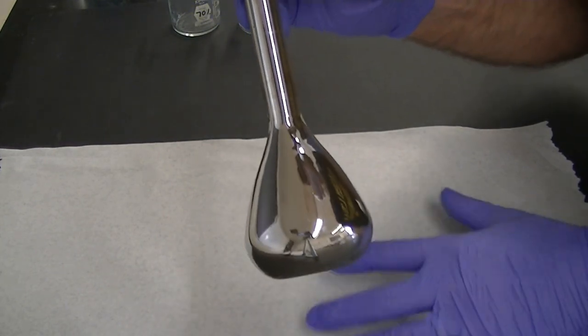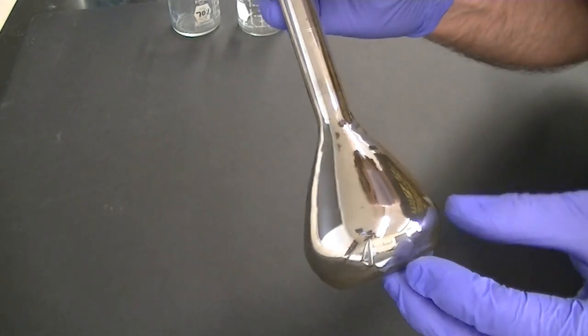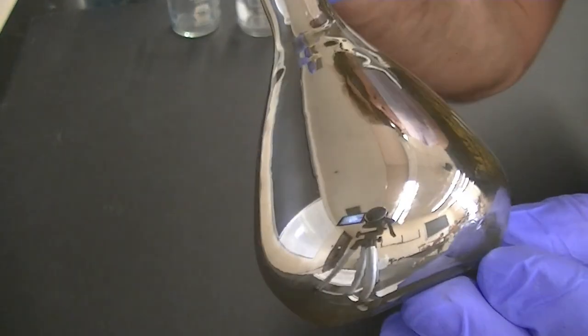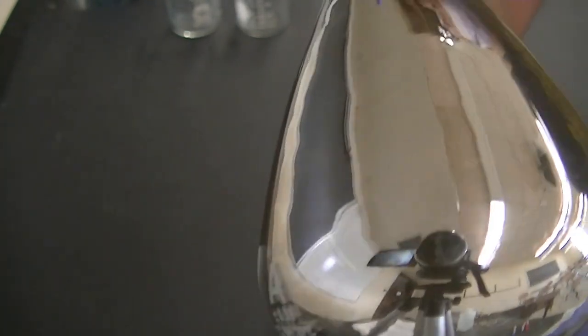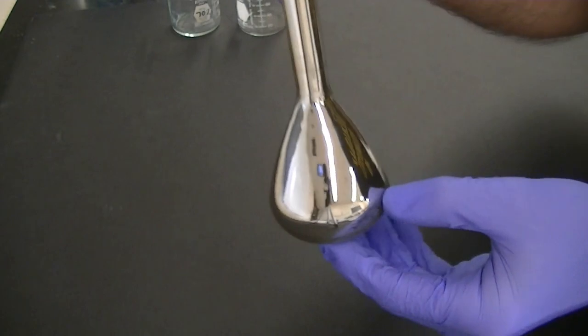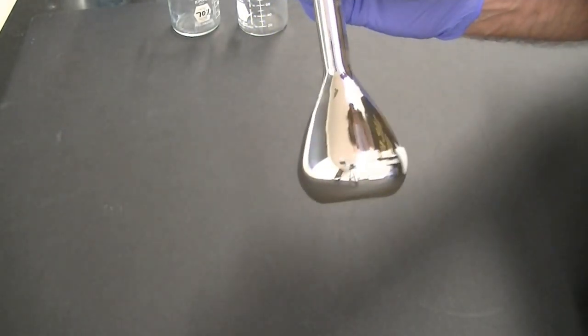The formation of a silver mirror is a fascinating chemistry experiment. In this experiment, silver ions dissolved in water react with certain sugars like glucose and fructose to produce silver metal. The silver metal that's generated can be used to coat a surface, forming a beautiful silver mirror.